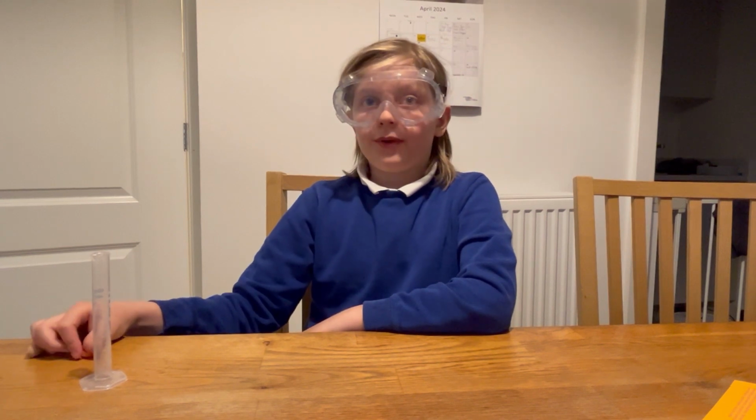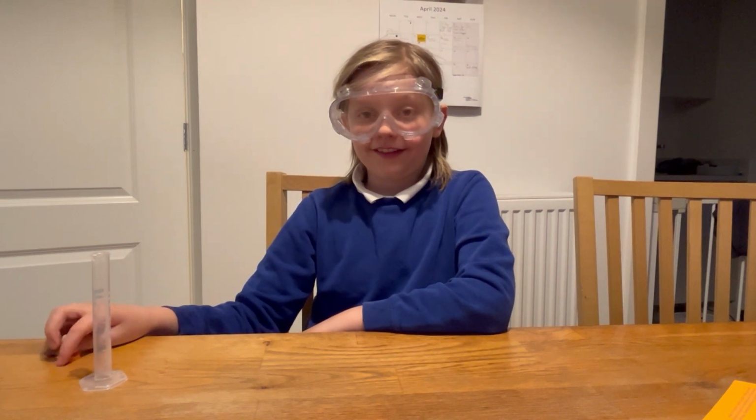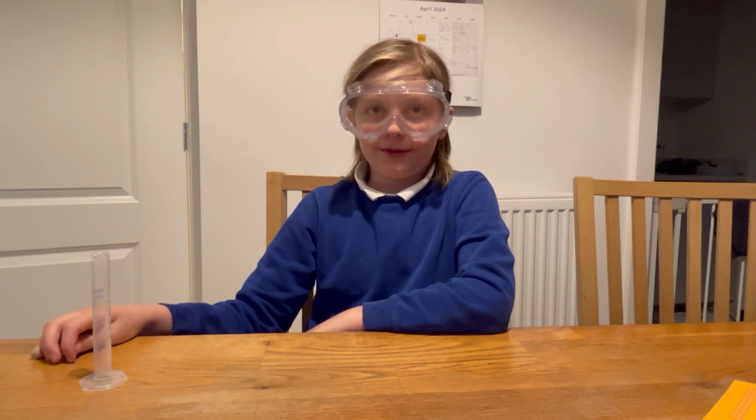It didn't really work well for us, though. And why was that? I kept pouring the liquid on.